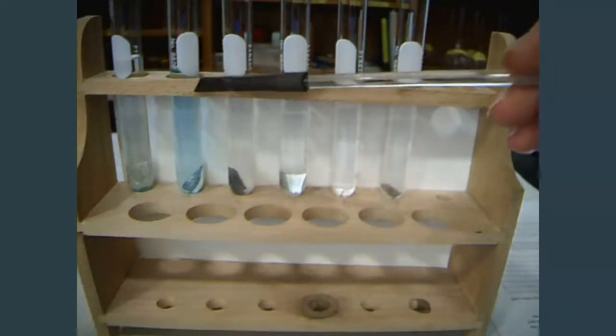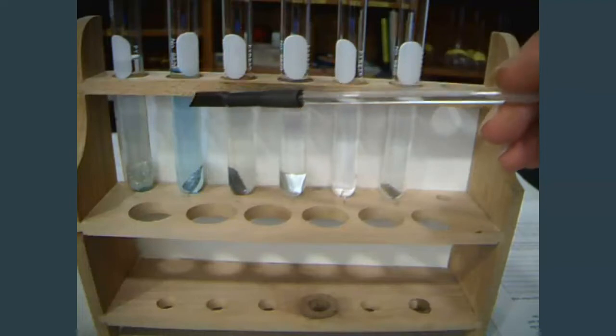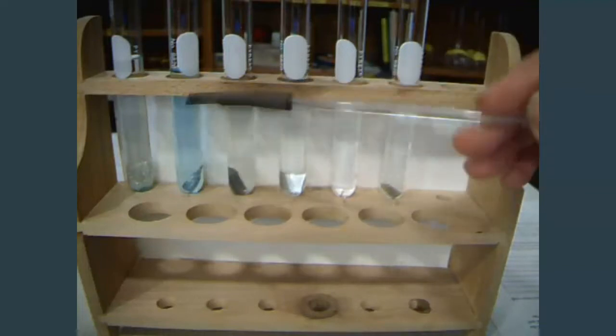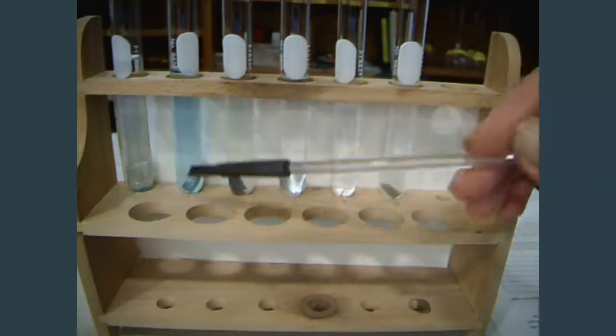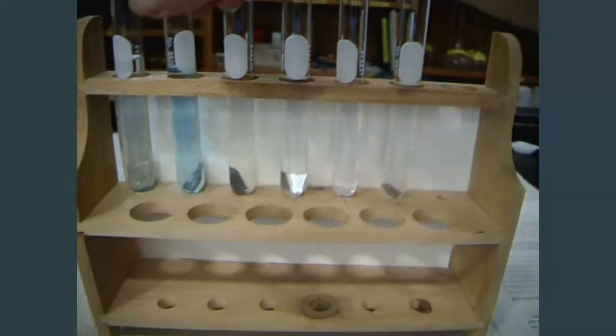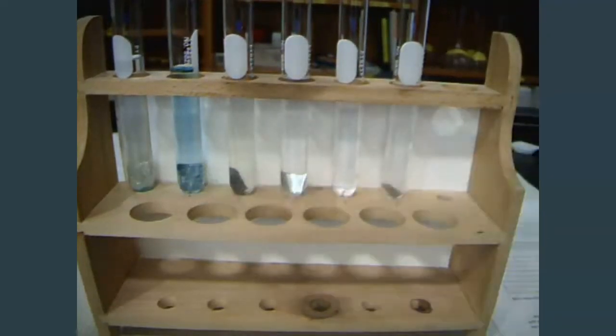Whereas this solution contained copper nitrate and lead. And we can see that it's much lighter colored than it was before. And if we turn this, we can see that our lead looks noticeably different as well. It looks kind of like something kind of growing on there.